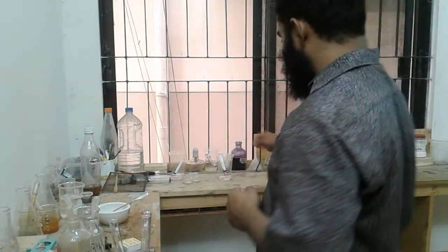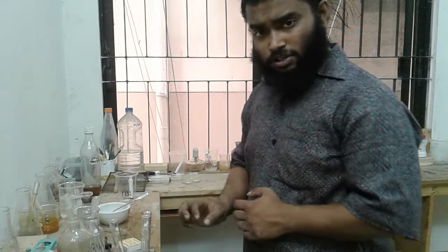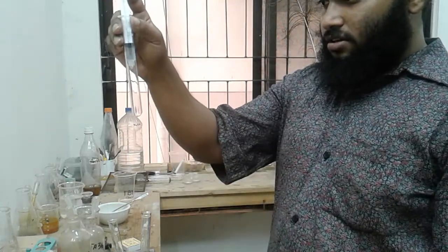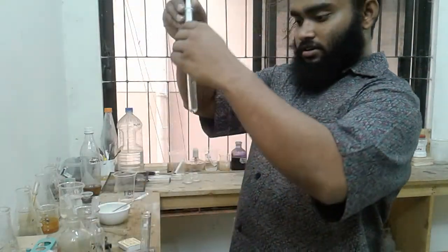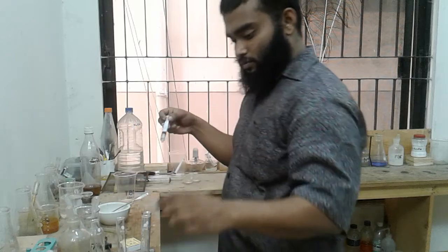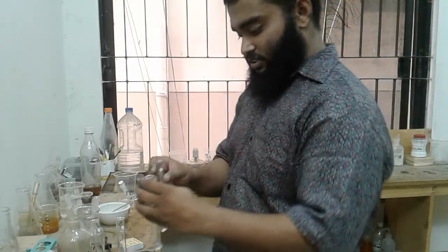It's a general rule that when you are doing tests on organic compounds, it's better if you just slightly heat the solution, because organic compounds are not all that reactive. I mean, it's just a trick. Okay, so I'm adding some FB1 over here, then a small amount over here, then a small amount over here, then a small amount over here. So these are all FB1 classes.